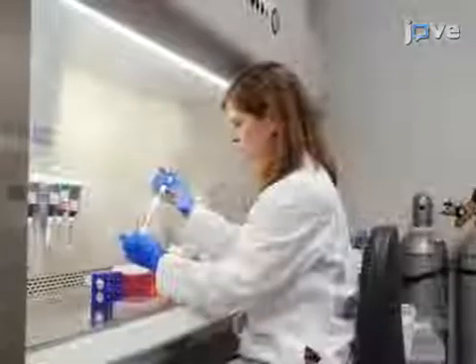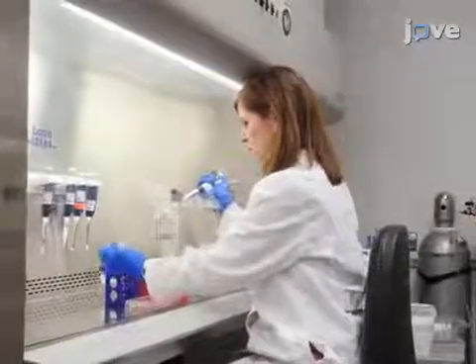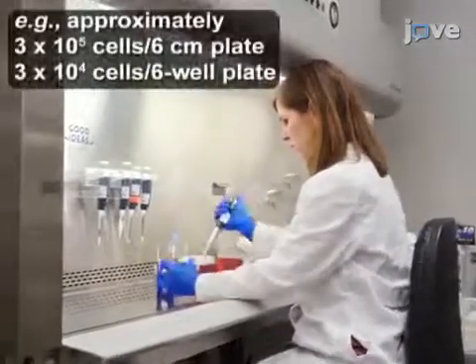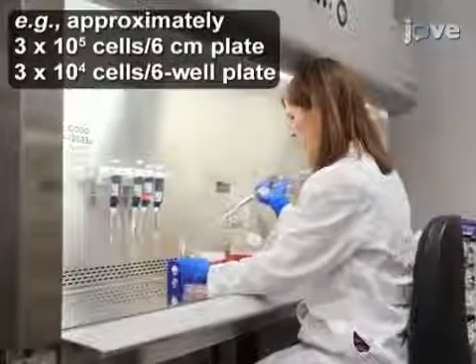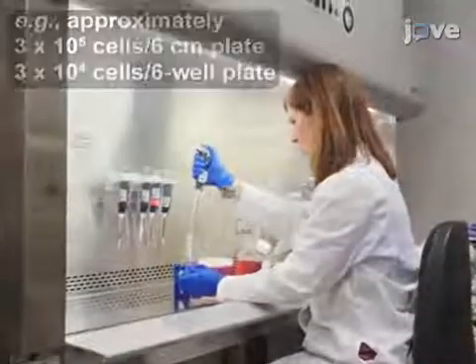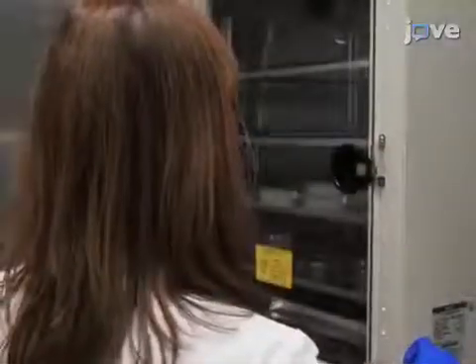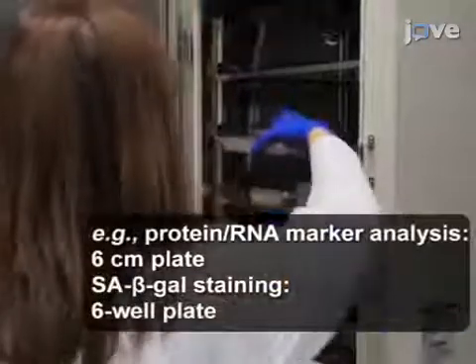Begin by plating the early-passage proliferative cells of interest at a sparse density in the appropriate dish for the analysis, and culture the cells overnight in a tissue culture incubator.